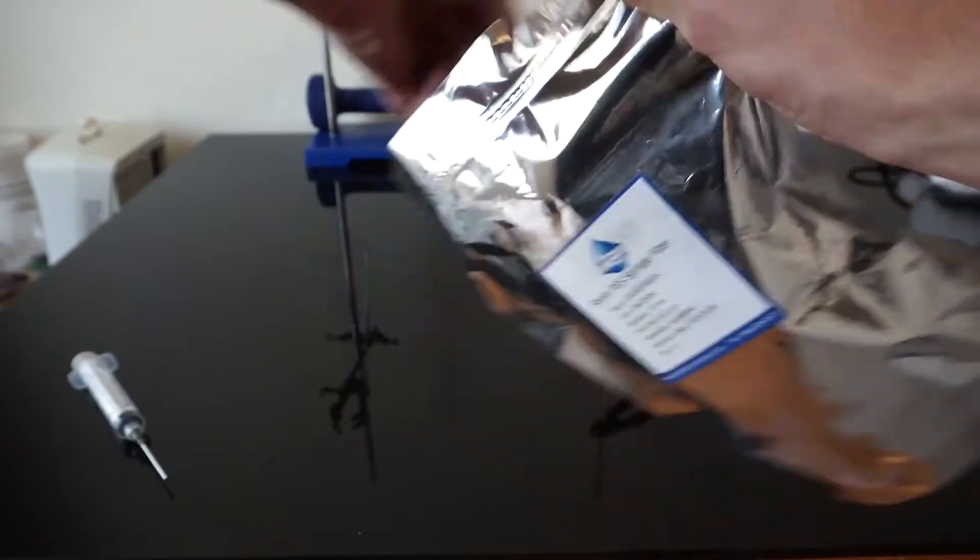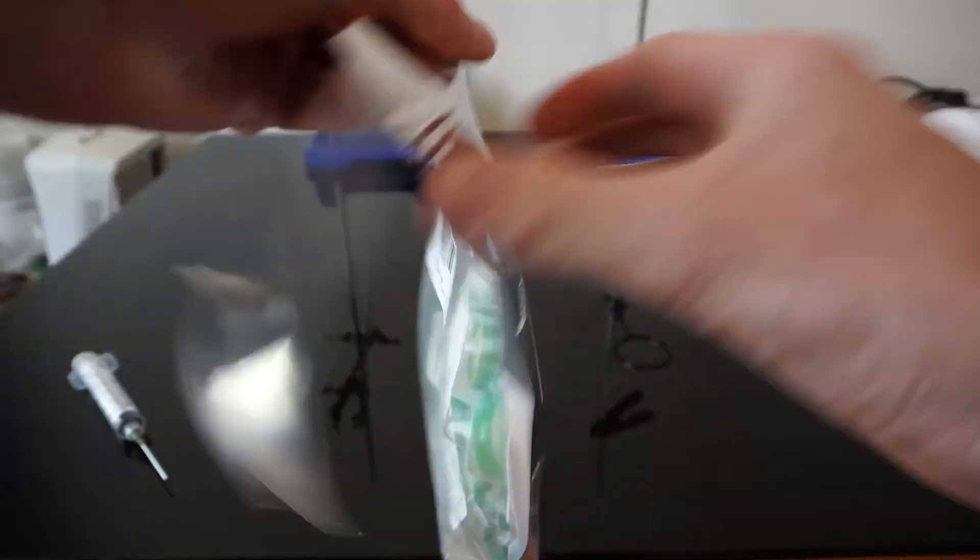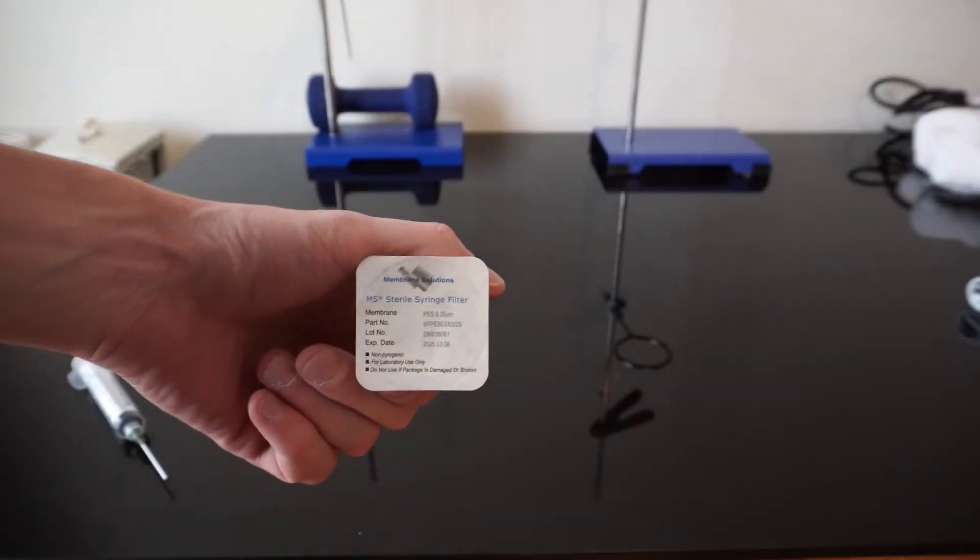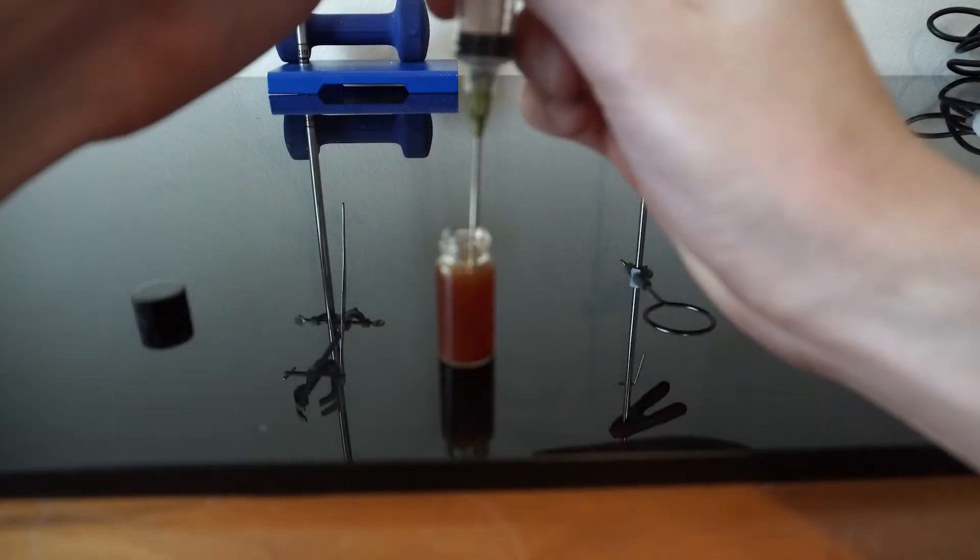The process that I'm using to do this is called winterization, which pulls the oils off, though leaves a lot of the fatty residues behind once I am able to filter it. It's at this point I put our pine sap mixture into the freezer to cool for about 10 hours.